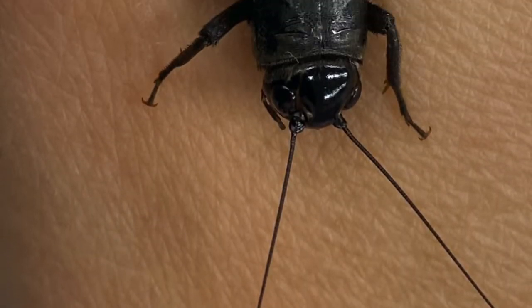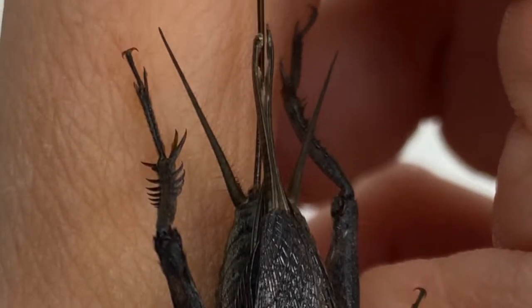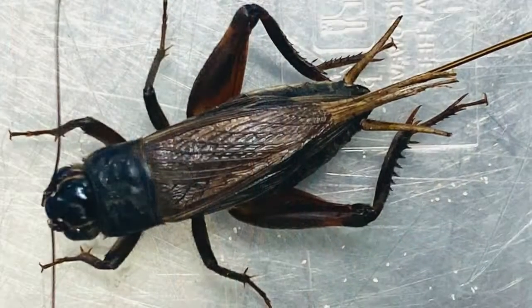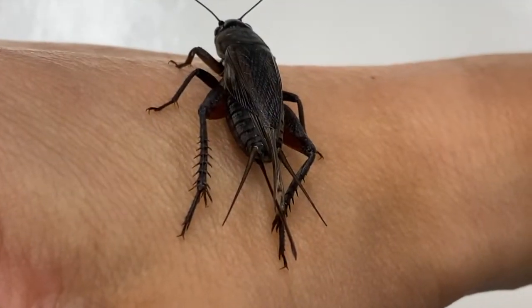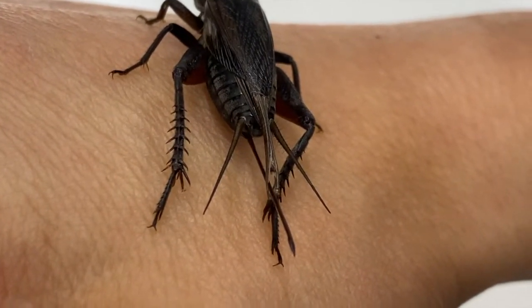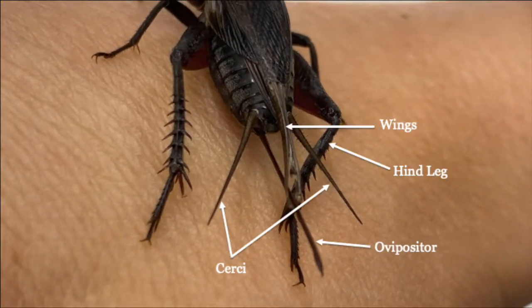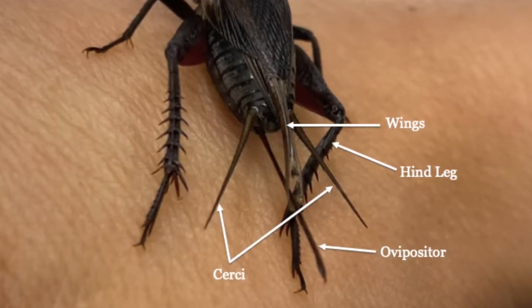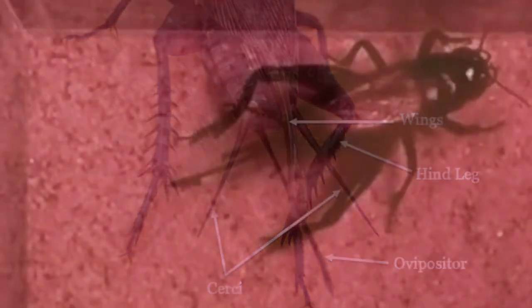Now let's examine a female cricket. The easiest way to tell a female cricket from a male is by the ovipositor. The ovipositor originates from the underside of the abdomen and is used to lay eggs. Sometimes the end of the wings, or the antenna-like rear appendages known as cerci, both of which are found in males and females, can be misidentified in a male as the ovipositor, leading to incorrectly identifying a male as a female. So make sure you can distinguish between them. The female will use the ovipositor to bury her eggs in order to protect them.